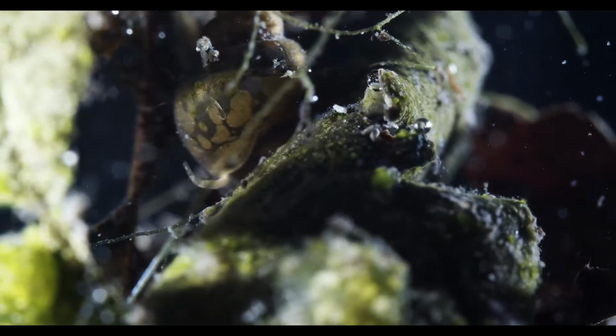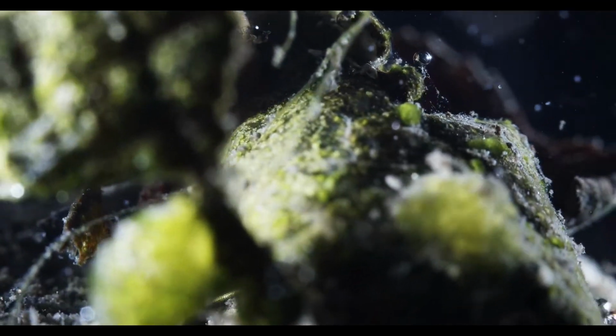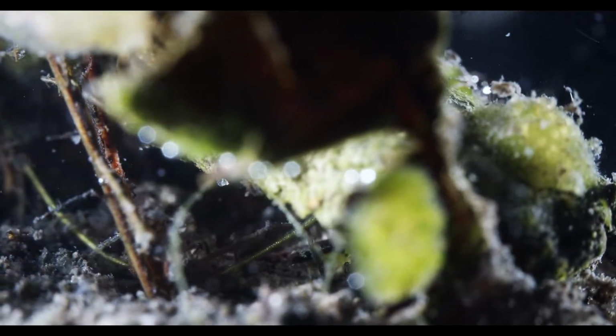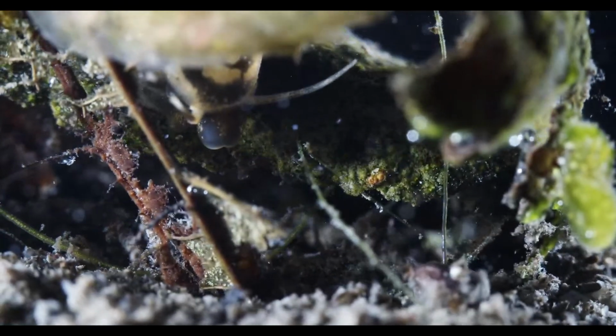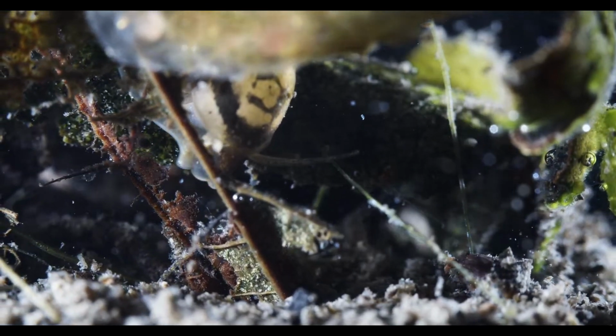Yeah, what I was talking about before is that a lot of critters come in so many varieties, like these small annelid worms that are generally referred to as detritus worms. They are not all the same species. There is, like in the sample we looked at in the last stream, for example.